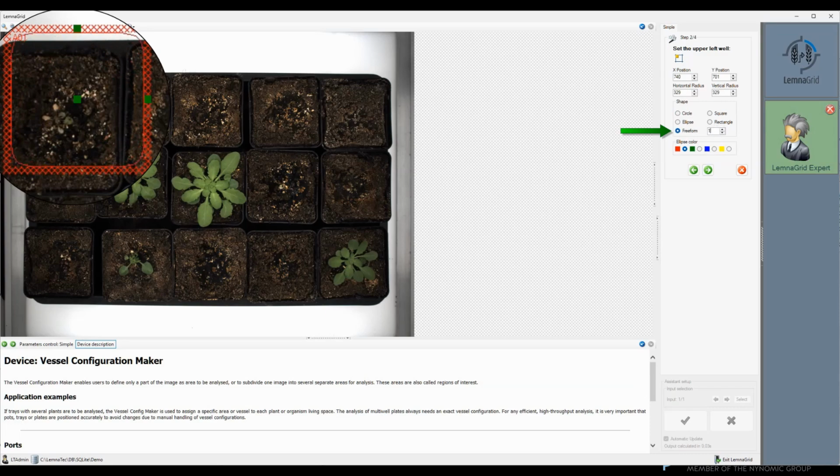If the parameter value is higher than 2, it becomes more and more square or rectangle shaped. At a maximum of 99, it is virtually a square or a rectangle. I choose freeform with a value of 8. This matches the almost square shape of the pots.